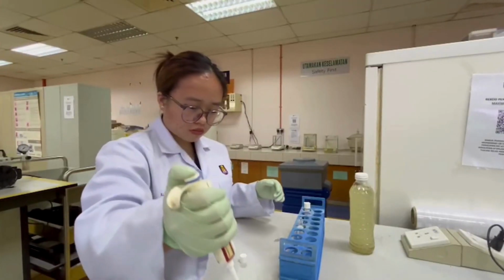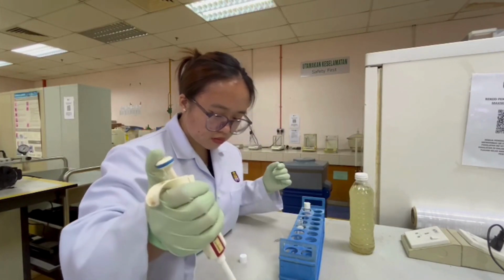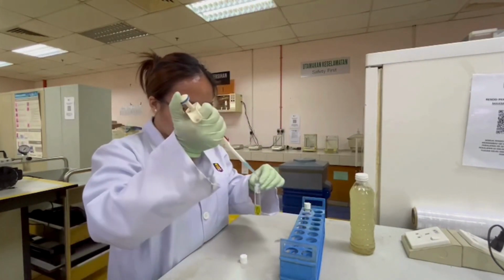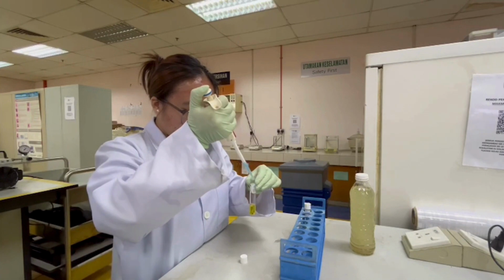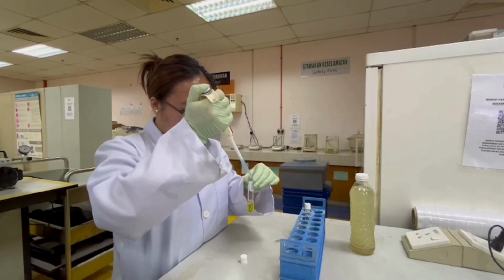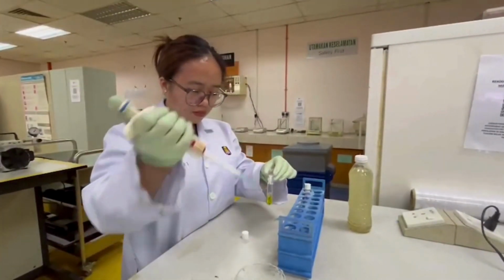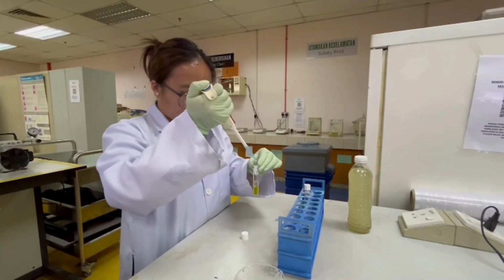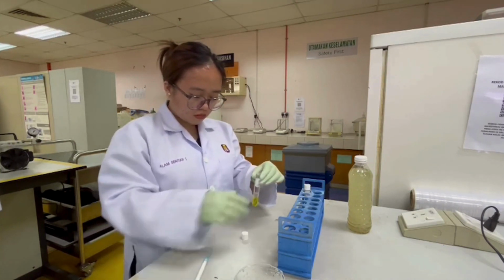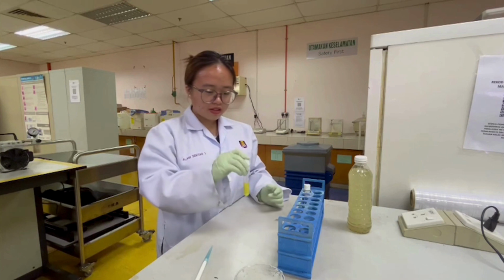A volume of 2 ml of the water sample was measured using a pipette and transferred into a low-range COD vial that was held at a 45-degree angle, directed onto the inner wall of the vial during the transfer. Then, for the blank sample, the step is repeated using 2 ml distilled water. Then the COD vial was capped and gently inverted multiple times to mix.